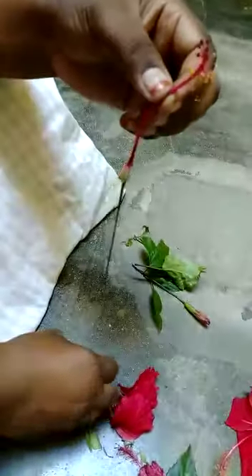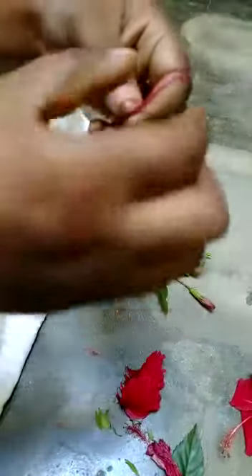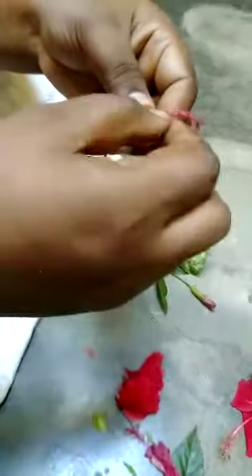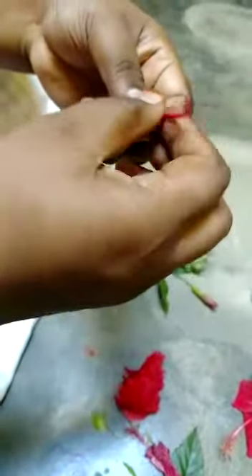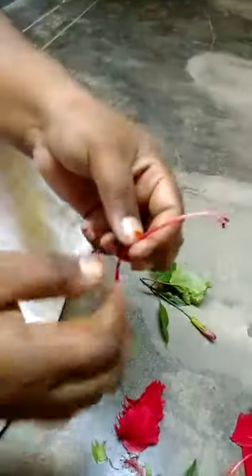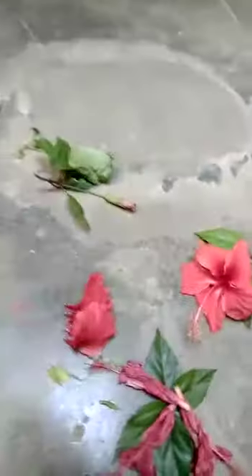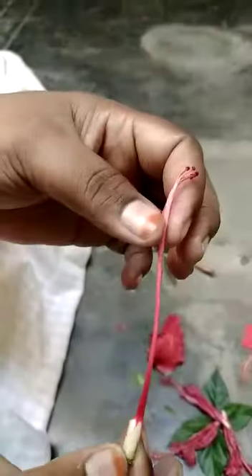The yellow color thing is called the pollen grains. Pollination occurs only through these pollen grains. I have removed all the male parts — the anther which is attached to the filament. See, as soon as I stretched it down, an ant is coming for the pollen grains, attracted by the pollen grains. The ant is coming and it starts to take on the job of pollination.